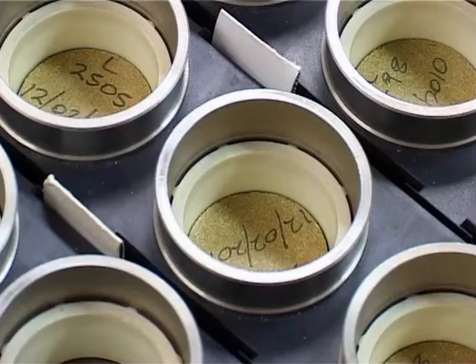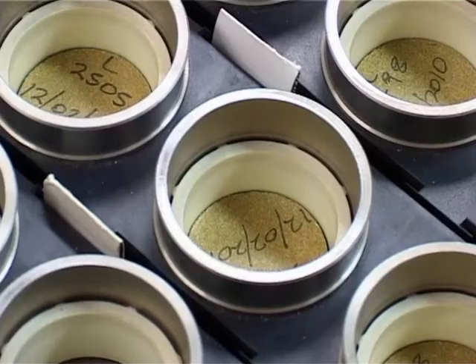This marks the end of the leaf analysis. We use quality assurance systems for all the analyses to ensure the accuracy of the results before uploading and generating fertiliser recommendations and reports. Control samples of known value are used to check the accuracy of your results in each small batch.